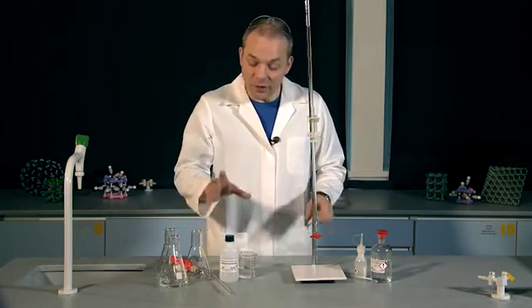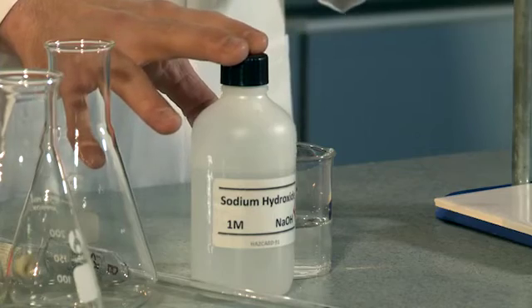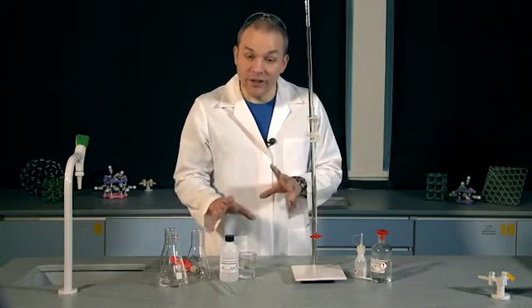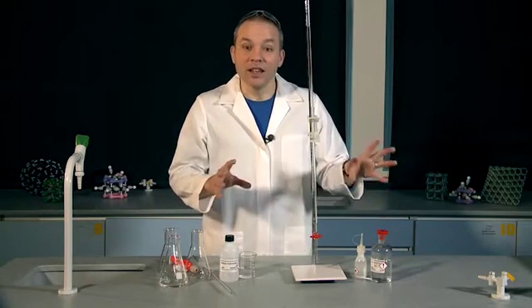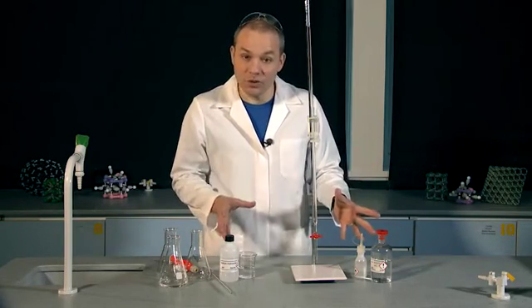I've got two solutions here. I've got some sodium hydroxide solution, a strong alkali, that I know the concentration of, and I've got some hydrochloric acid solution, a strong acid, that I don't know the concentration of.